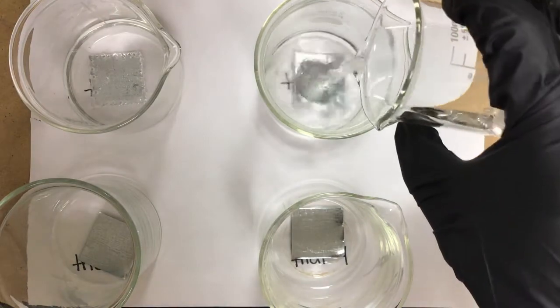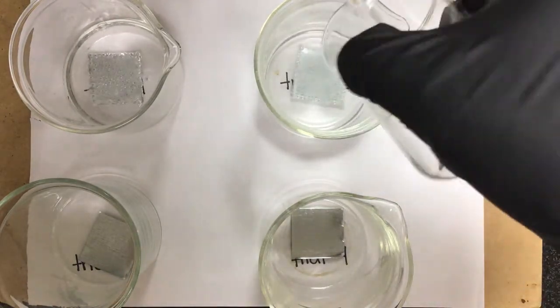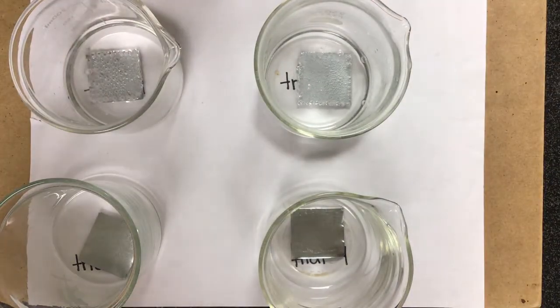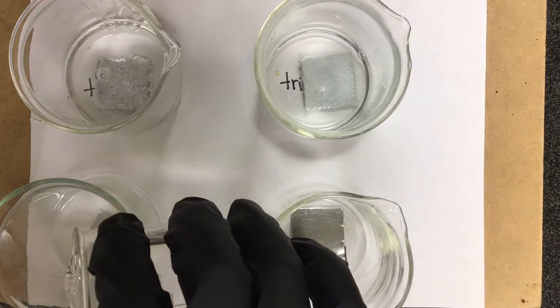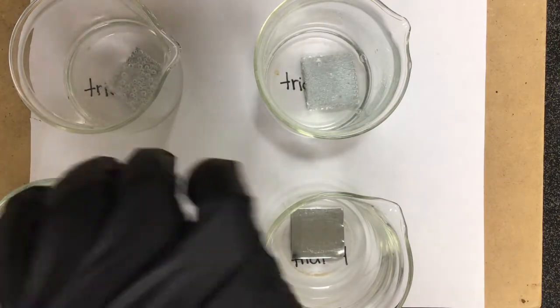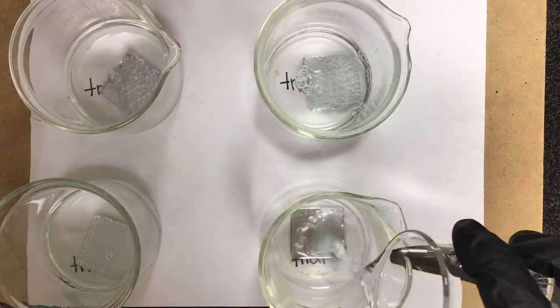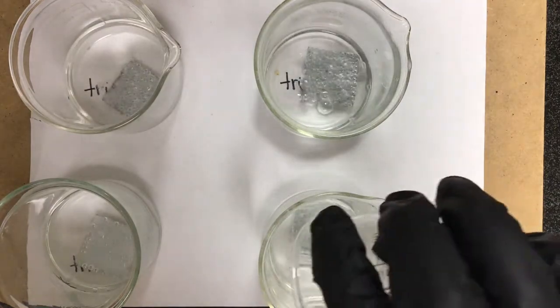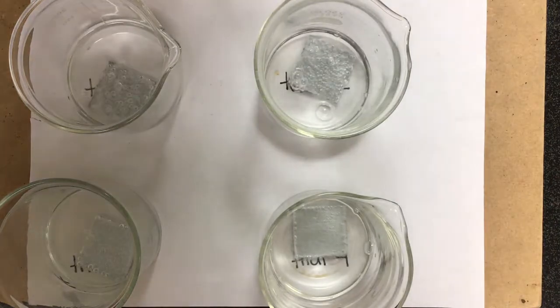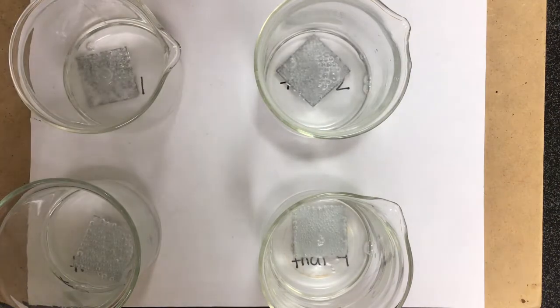And again, as a reminder, what's happening there is that the hydrogen ions are pulling electrons away from zinc atoms. And in doing so, those hydrogen atoms are finding one another, forming hydrogen gas, and that's escaping out of the solution. And then zinc is going to find chlorine, or specifically the chloride anion, and it's going to form zinc chloride. So you're seeing that reaction occur there. So I'll let that go to completion.